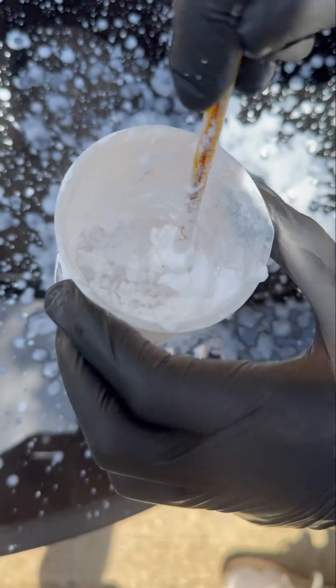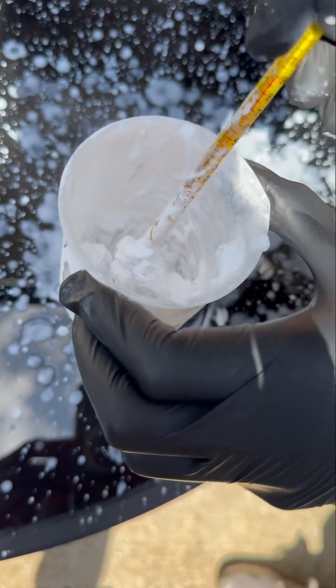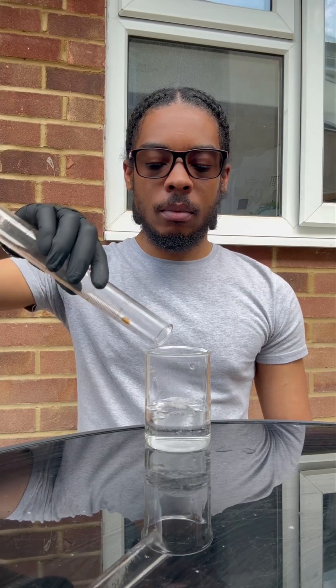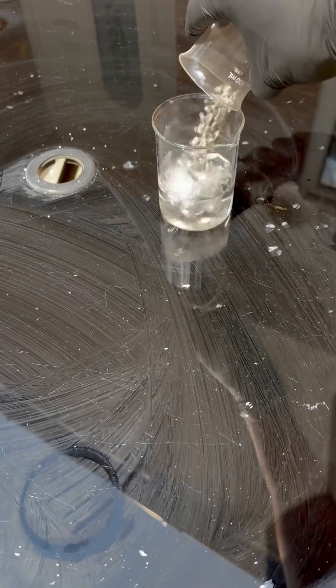Alright cool, so now we're gonna pour out some hydrochloric acid and then slap the calcium in there. Oh my days bruv, instant reaction again fam.